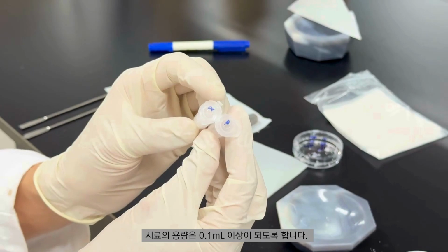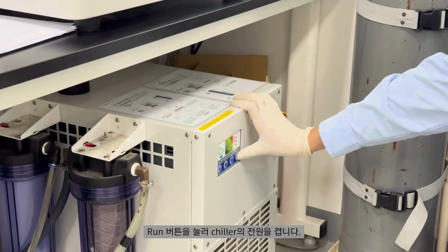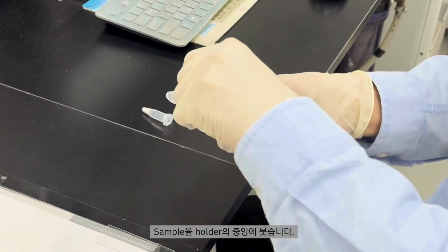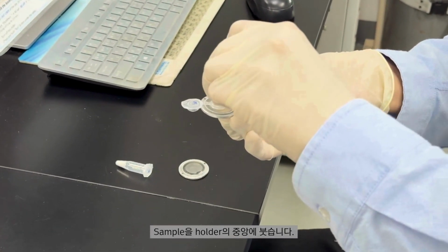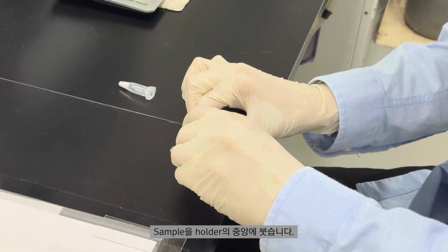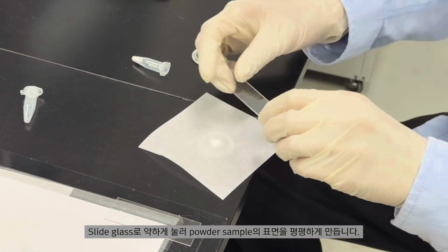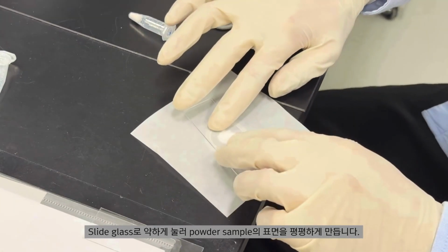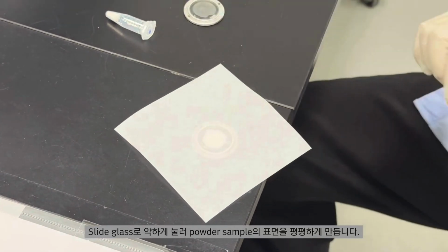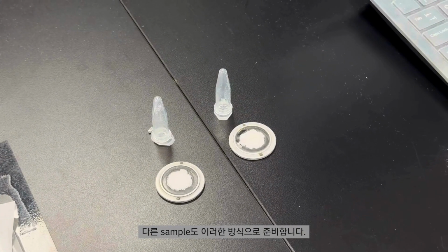Ensure that the sample volume is at least 0.1 milliliters. Press the run button to power on the chiller. Pour the sample into the center of the holder. Press gently with a slide glass to flatten the surface of the powder sample. Ensure that the surface of the powder is flat. Prepare the other sample in the same way.